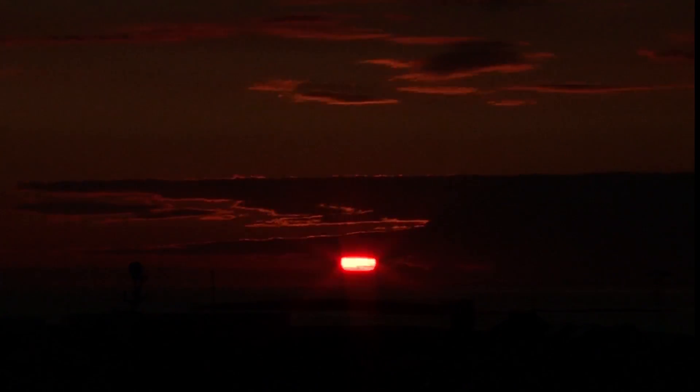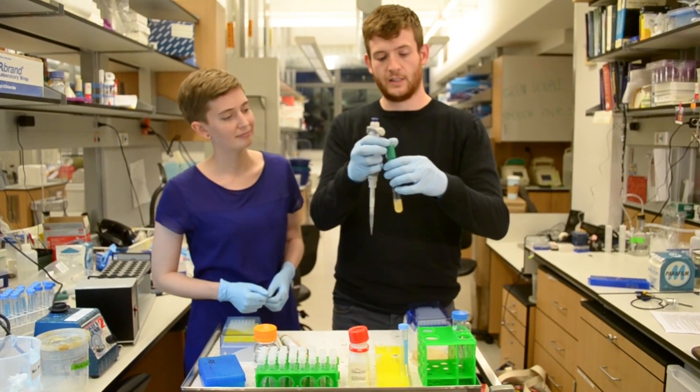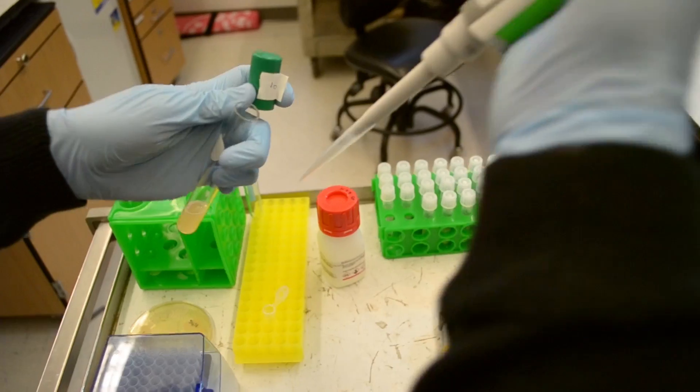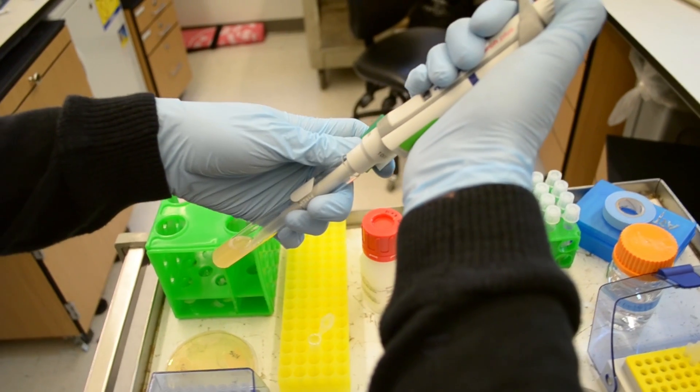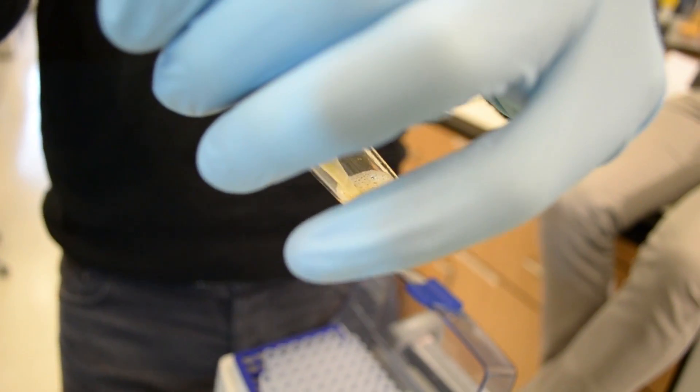Now it has to incubate overnight. And now it's ready. In this tube we have our yeast cells which have been growing mitotically overnight. They're all happy and they've been dividing lots. I'm going to put some of them in this tube.